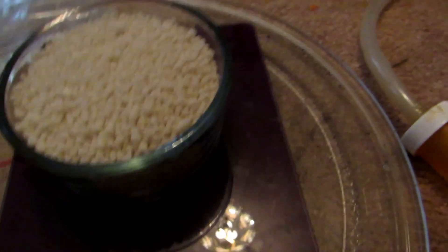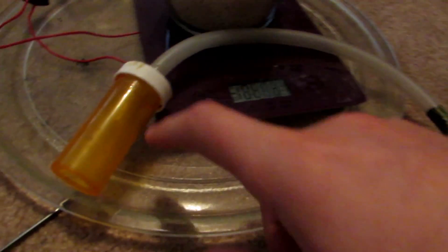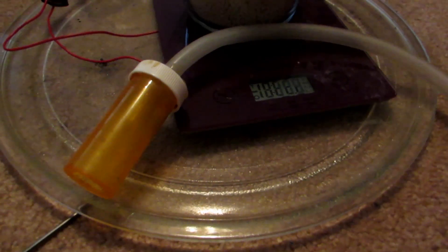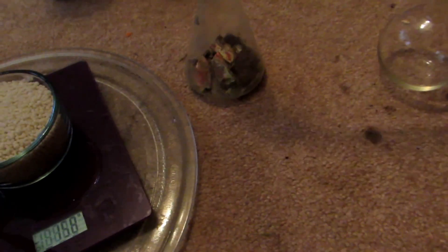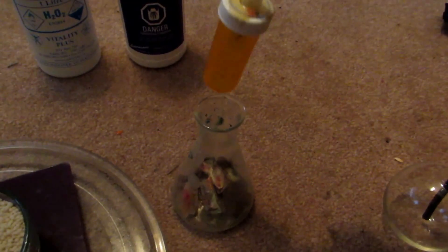The other thing we're going to need is a simple apparatus like this. I just have a pill jar here — this could be any jar, or you could use a stopper. I just prefer to use jars because I don't like always drilling into stoppers. You just need a short length of tubing into a cork stopper. Then there's an exhaust port, which I use because sometimes nitric acid will form in here and drip off and you can collect it. It's just for extra yield, but you don't really need this glass tubing. So how this is going to work is you're going to have your two flasks — this one full of hydrogen peroxide or water, and this one filled with copper and calcium ammonium nitrate, and also some hydrochloric acid. These things just kind of all fit together like this, and pressure is created, nitrogen dioxide gas is generated and bubbled through your solution, creating nitric acid.